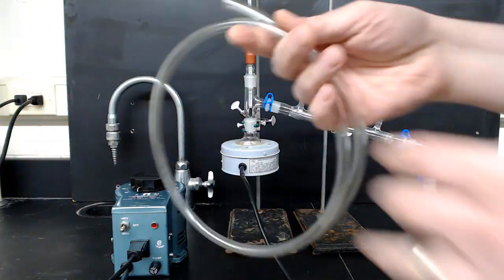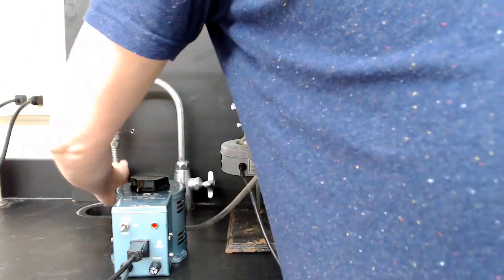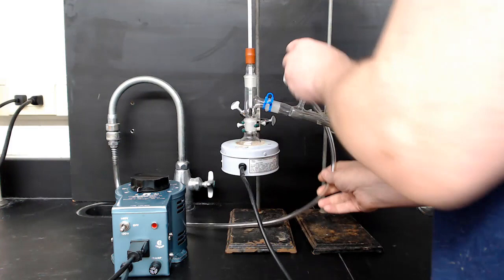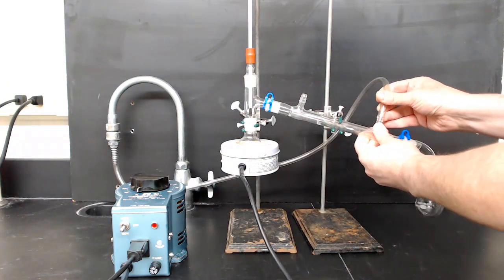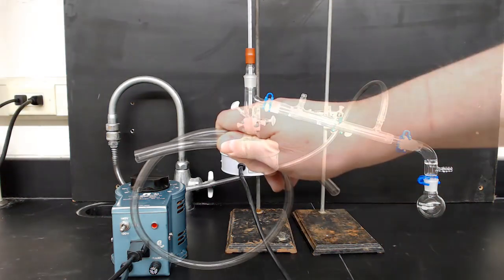In the next step, we're going to be attaching hoses to our condenser. Attach one end of the hose to the hose barb on a cold-water faucet near a cup sink on your lab bench. The other end goes into the apparatus and should go into the bottom hose barb of your condenser. It's important that the condenser water go in through the bottom.